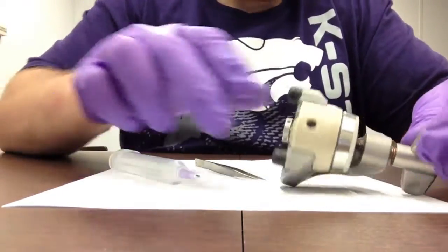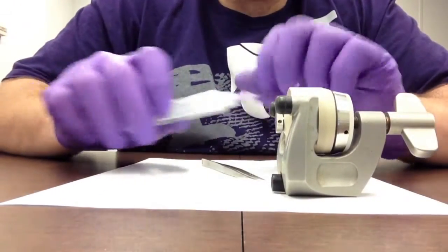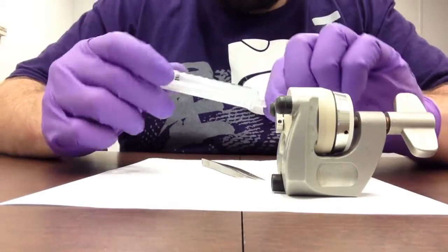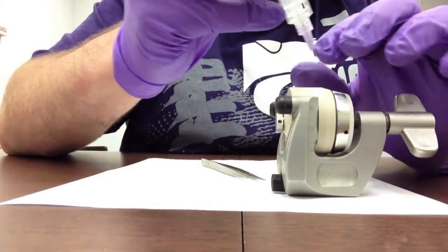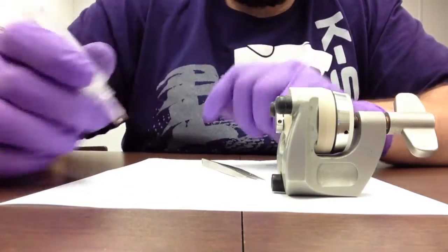Having a little electrolyte left over, I usually take a piece of towel and try to dry out at least the threaded portion of it. Then taking a piece of lithium on top of our inner side of our bench table on our glove box, I take this syringe.